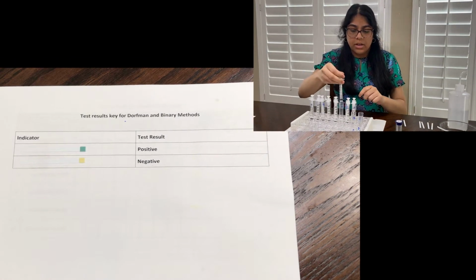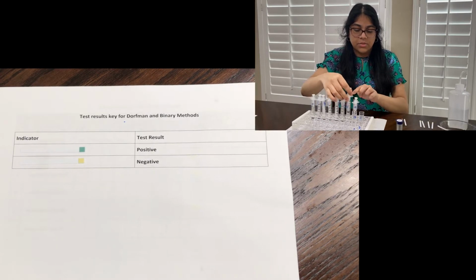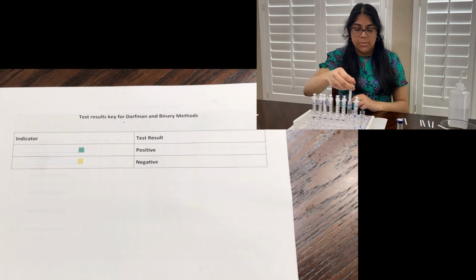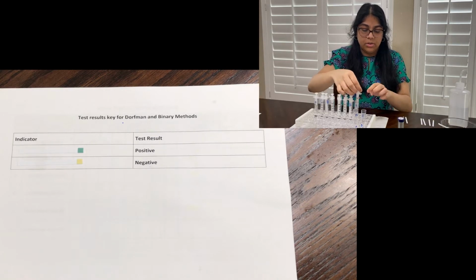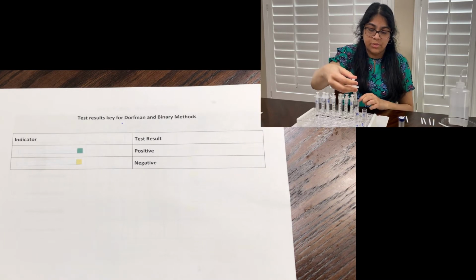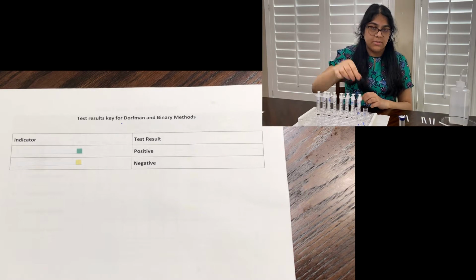I am using different syringes for each test tube, and this is to reduce any chances of cross-contamination because for the pooled test that will not have any kind of glucose solution in it, we want to make sure that that stays completely yellow to kind of reflect how that does not have the infected sample in it.